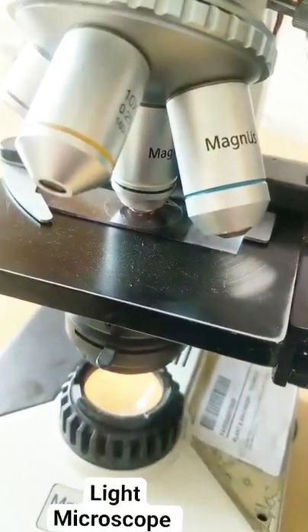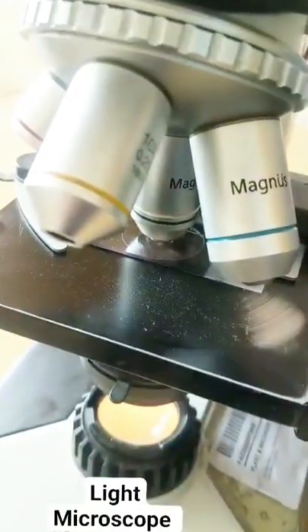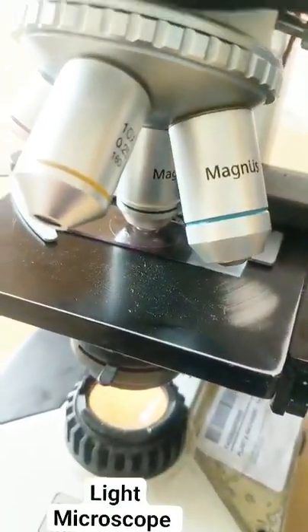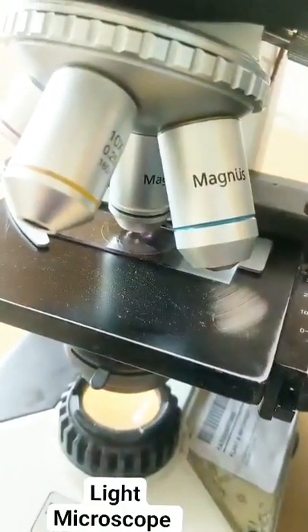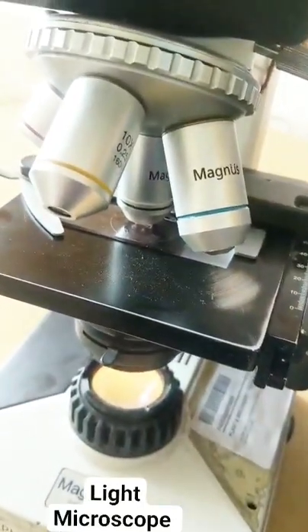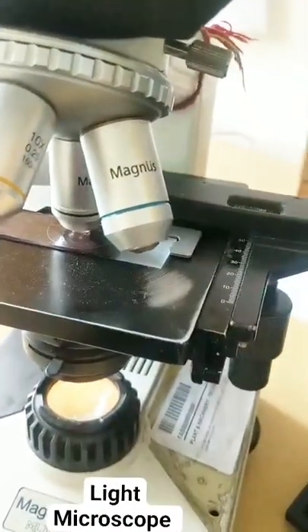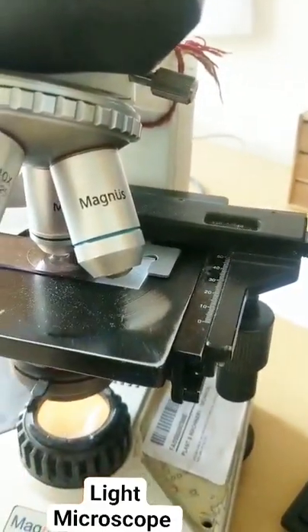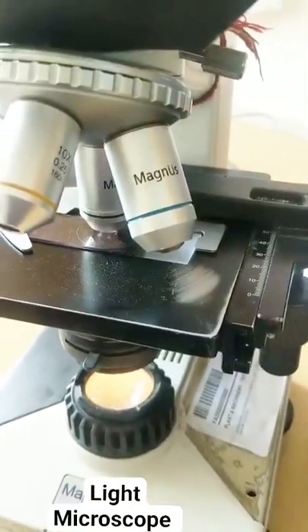Now I want to adjust it as per my vision. So I will move this tiny knob. When I move this tiny knob, you can hardly appreciate that movement because this is just to adjust it as per your sight — this is fine adjustment. Further, you have a scale over here. In some cases, you might want to measure the distance of something you see microscopically, so there's a scale present known as the Vernier's scale.